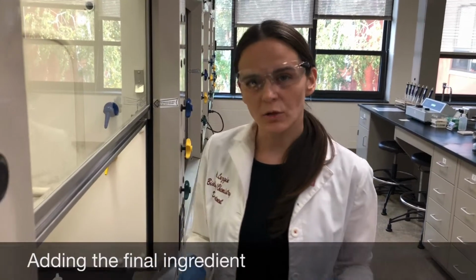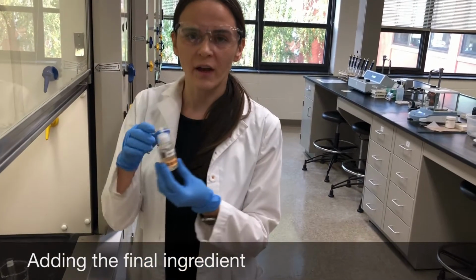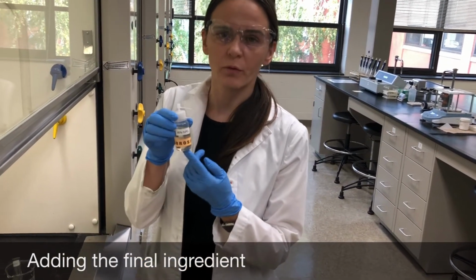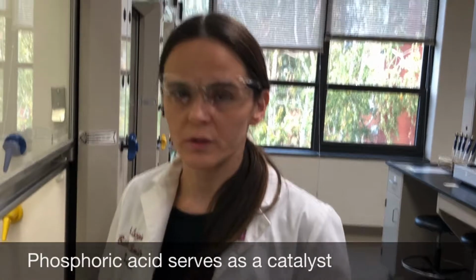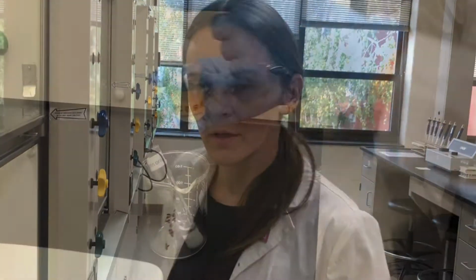Okay, so my last ingredient that I'm going to add to make my aspirin is 85% phosphoric acid, H3PO4. Phosphoric acid is going to serve as a catalyst. A catalyst is something that speeds up a chemical reaction.